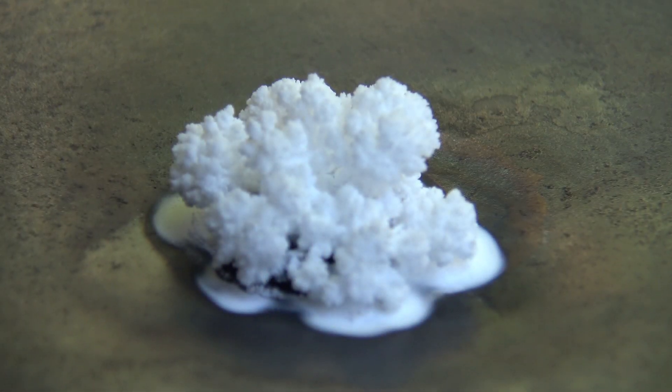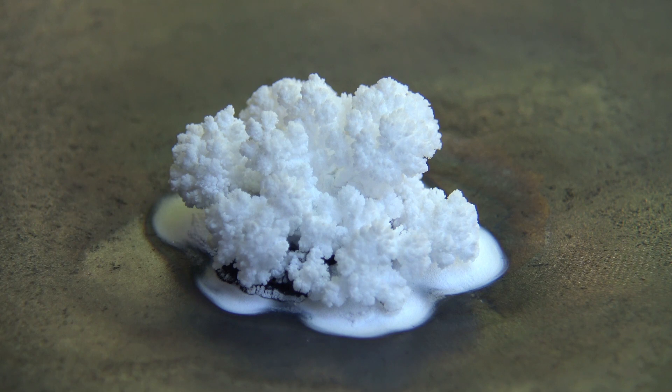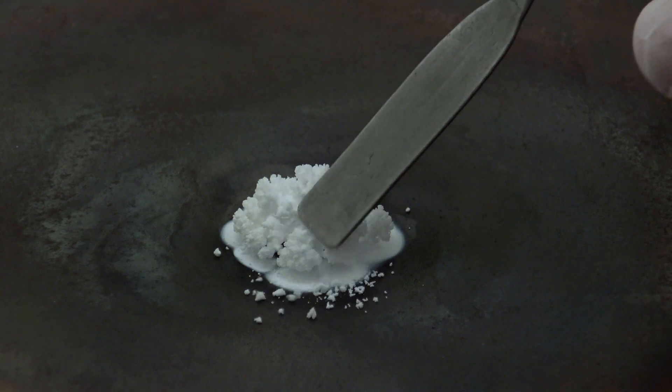What's interesting is that the lithium oxide stays on the outside of the residue. Below is a dark solid which has to be lithium nitride.